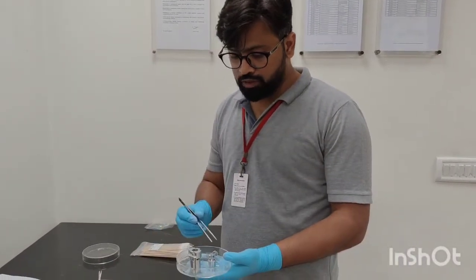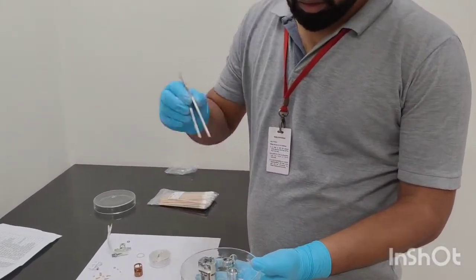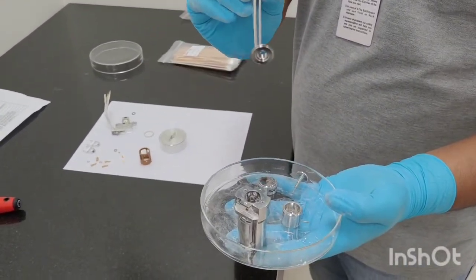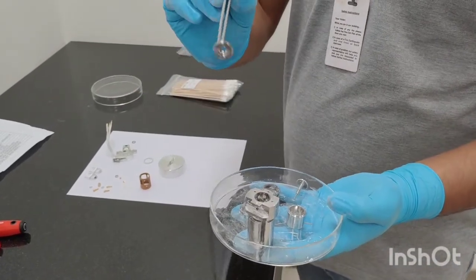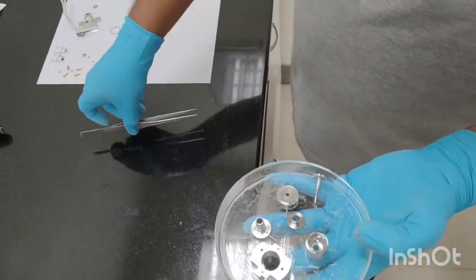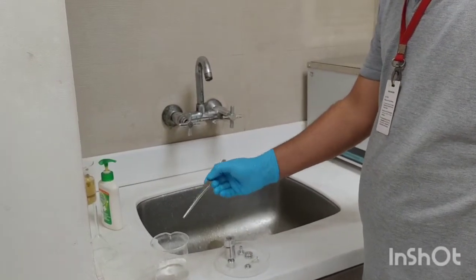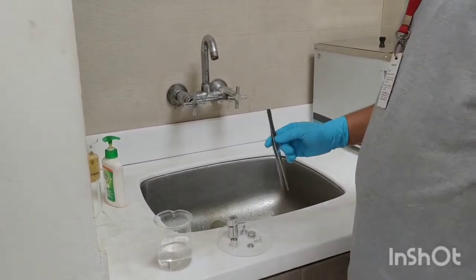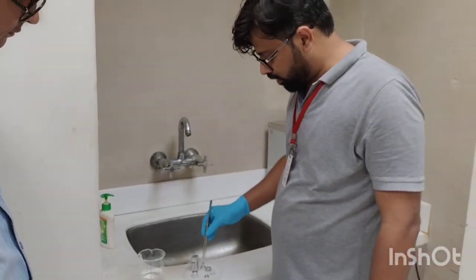We have to clean all these parts, and now I am going to add this part also. So in total: one, two, three, four, five, six parts. This part we don't need to clean much with the aluminum oxide powder, but when we are sonicating all the metallic parts we can sonicate this part too. So all together we have six parts. Now we have to go to running water. In this beaker I have taken approximately 150 ml of acetone — you can also use methanol instead of acetone.